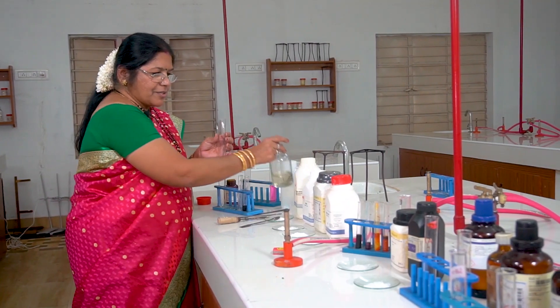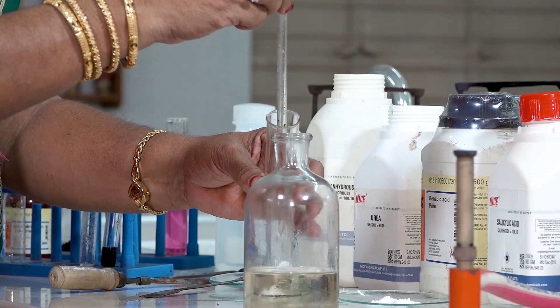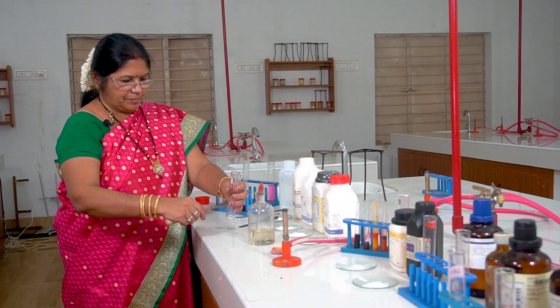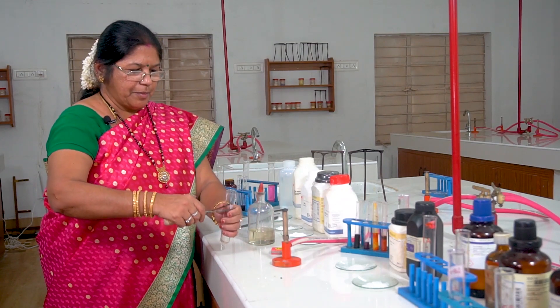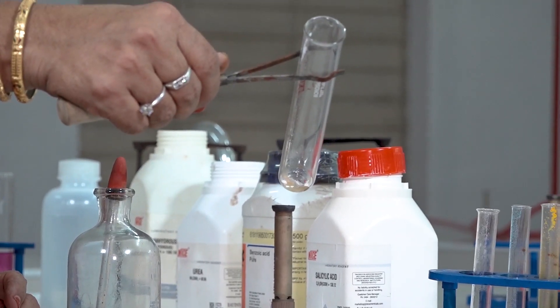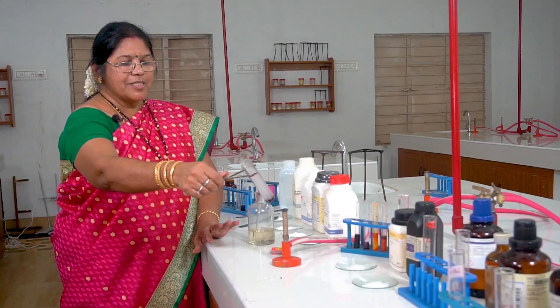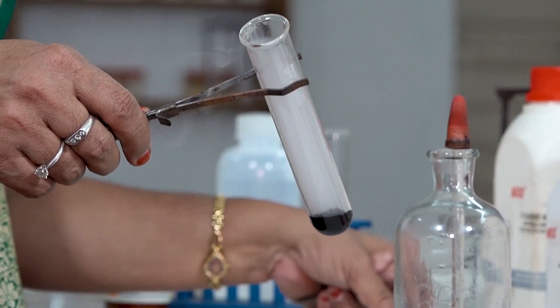This is concentrated sulfuric acid. I'll add some drops of concentrated sulfuric acid to it. The concentrated sulfuric acid reacts with the glucose carbohydrate — this reaction is called dehydration of a carbohydrate, specifically glucose carbohydrate.